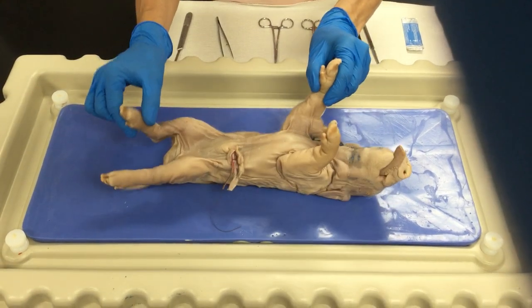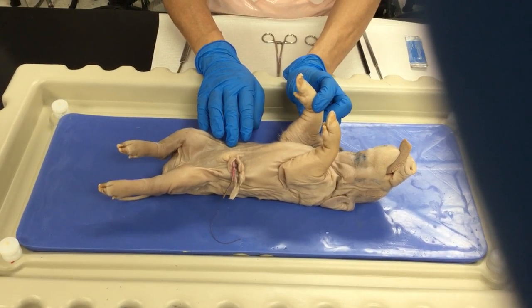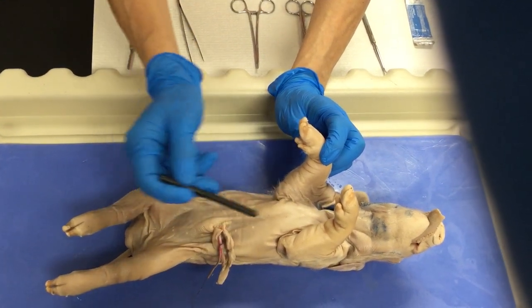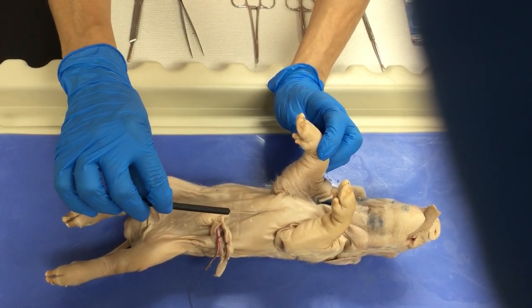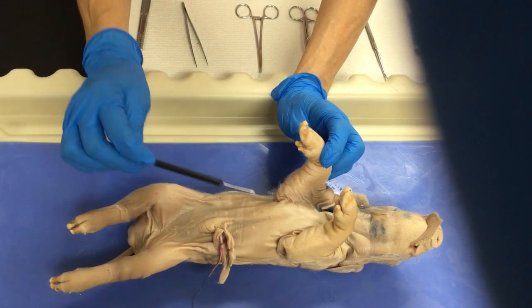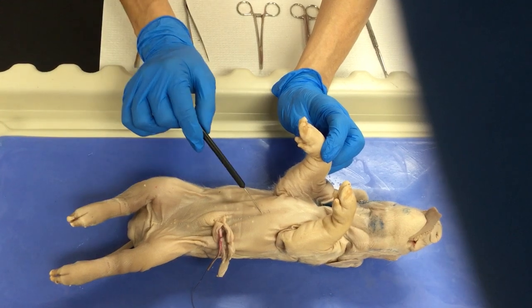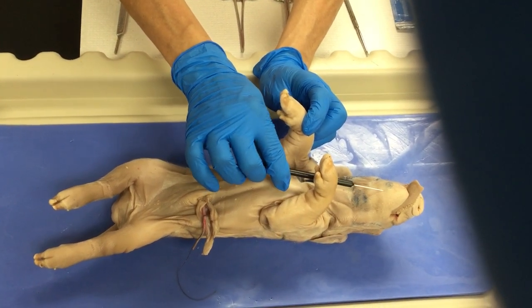This is a fetal pig and you can start making an incision according to what the manual says. Basically it's doing a medial incision starting here at the xiphoid process. This is the thoracic area and this is the xiphoid process of the sternum. Then you will go down in the anterior wall of the abdomen just in the midline. The first incision you will do with the scalpel, and then you continue with your scissors going up into the mandibular symphysis.